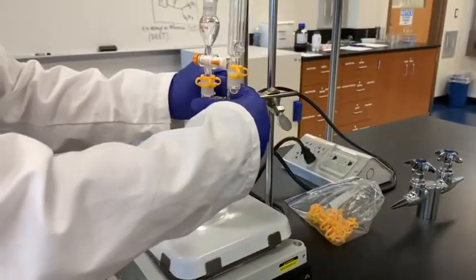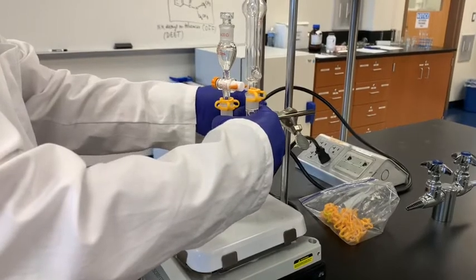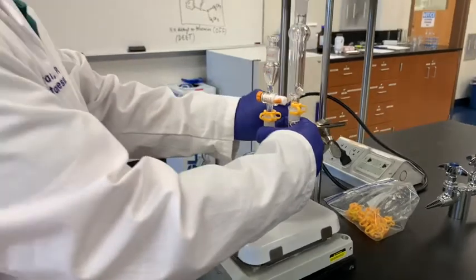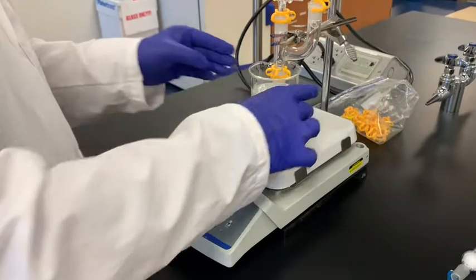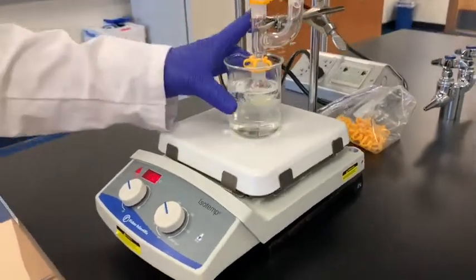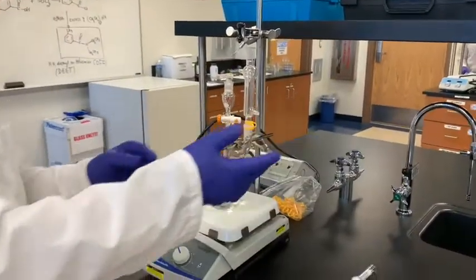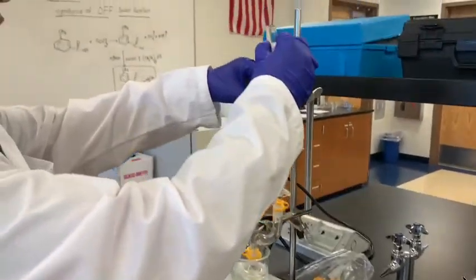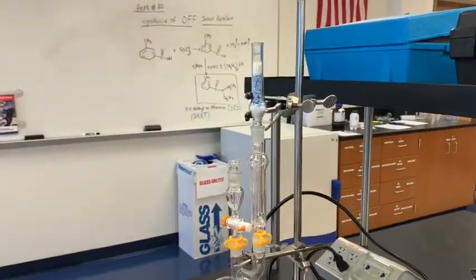So it's all approximately boiling. 100 is the boiling point of water. I lower this a little bit so that it will be inside the water here. I will heat this water just to boil, so that the temperature can get to 90 degrees Celsius. This is how the setup is done. On the top of this, in order to avoid any vapor going around, we use this calcium chloride drying tube also, so that the moisture cannot get in there. So this is how the setup will look.